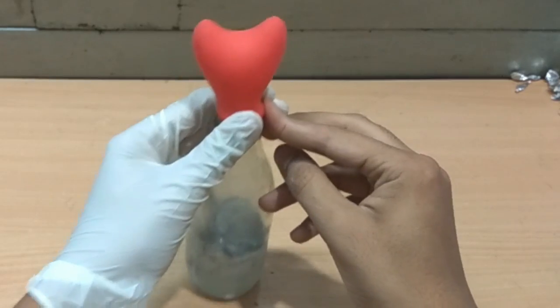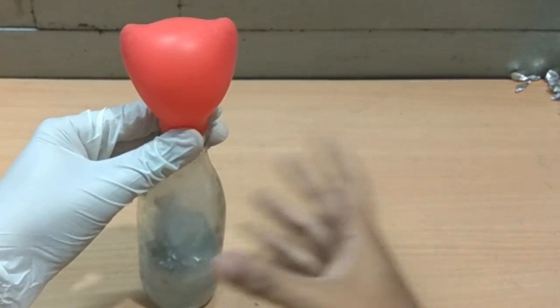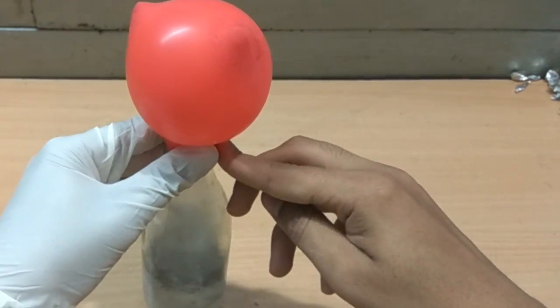This reaction is exothermic, which makes the glass bottom very hot to touch. I think this is enough now.